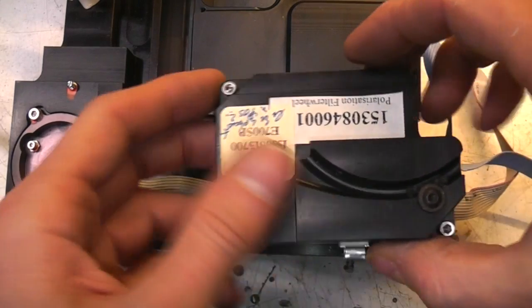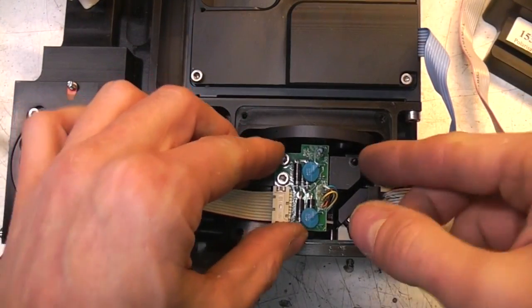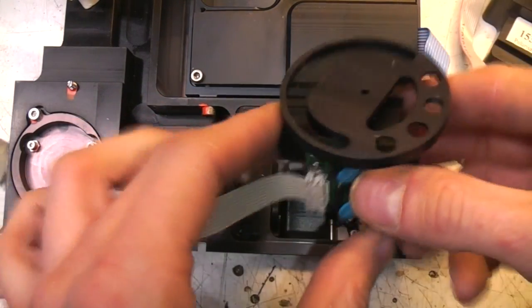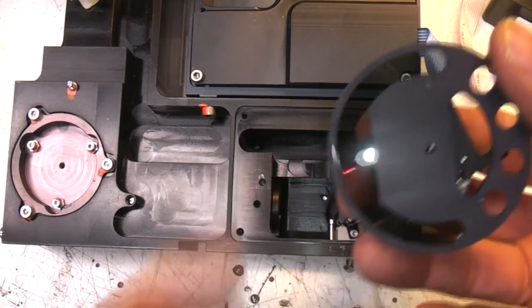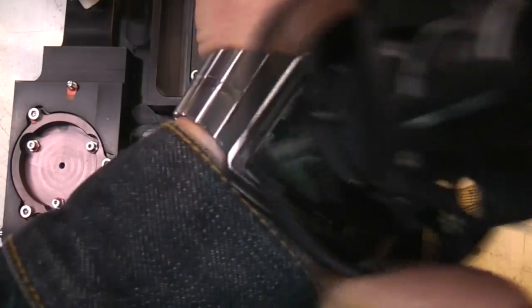So this is the polarization filter wheel, which, as you'd expect, is a wheel with a polarization filter. We can prove that if I just look through an LCD.